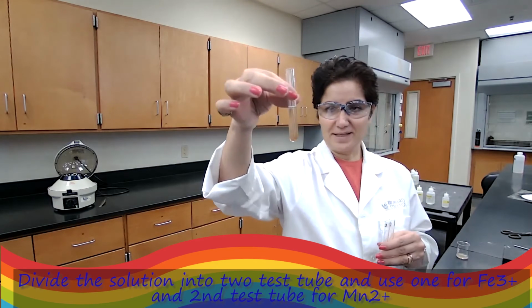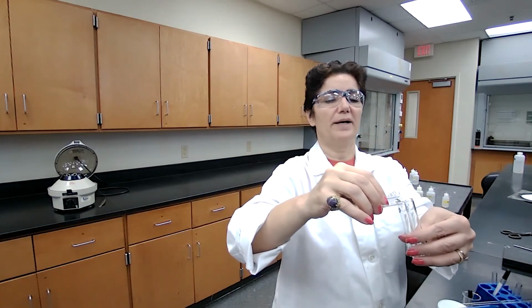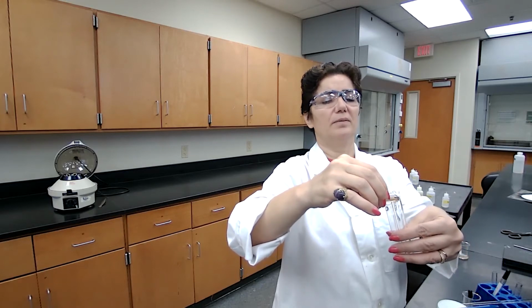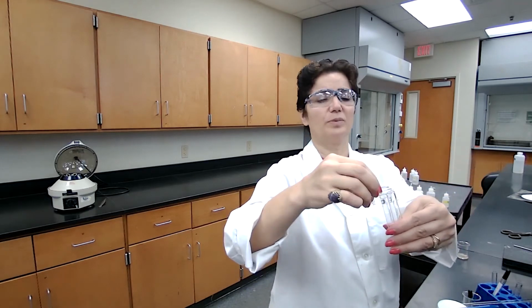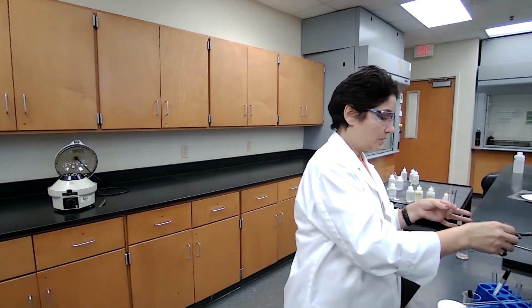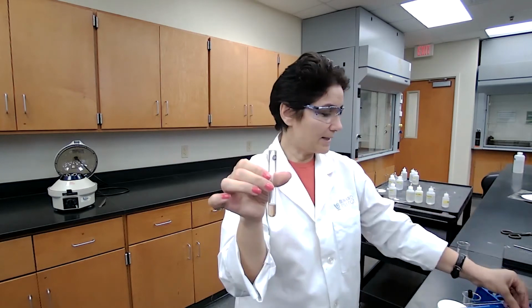Okay, the precipitate has dissolved in nitric acid, and I'm going to divide it into two aliquots. One is test tube D, and the other one is test tube E, based on the procedure. And we are using test tube D for manganese.